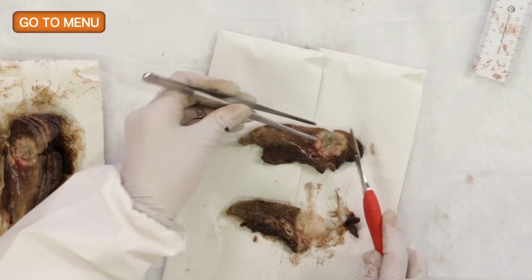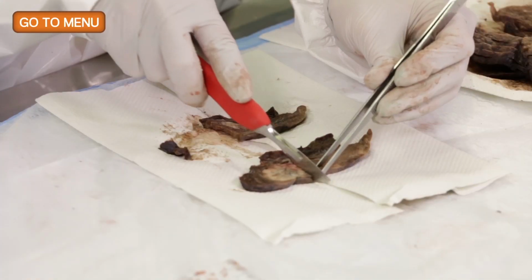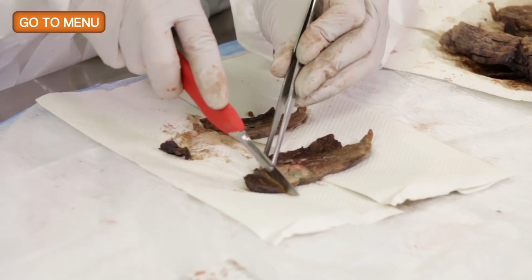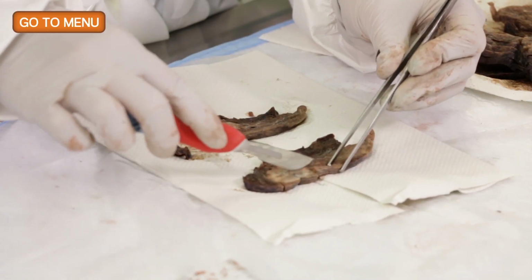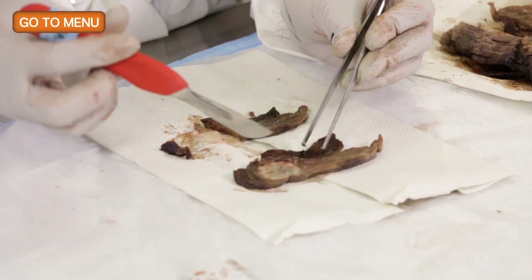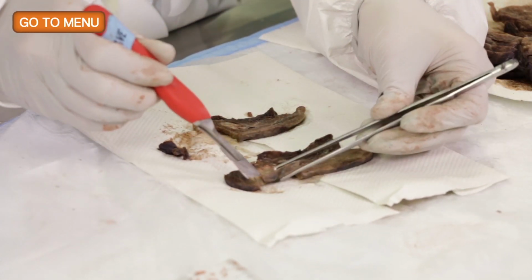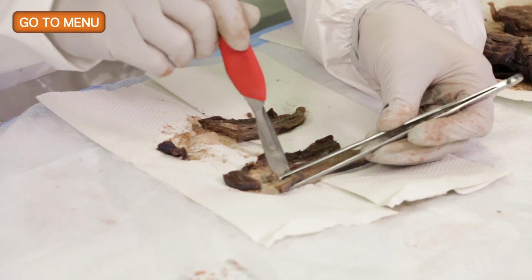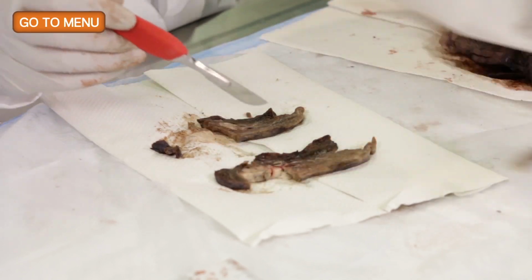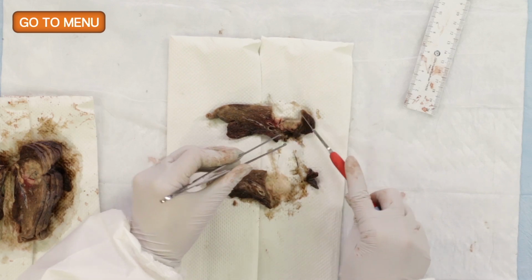So with this section, I'm also going to have another pleura to tumor, and I'll have this section to also have tumor to normal. Okay. So again, when taking the sections of tumor to pleura, it's important to really get the complete base of the pucker. And you can see that in the section that Esther's cutting right now, in that the base of the pucker is V-shaped. This will be the area of maximal retraction, and is usually the area when there is invasion that we'll find the pleural invasion. So that's a very important section.